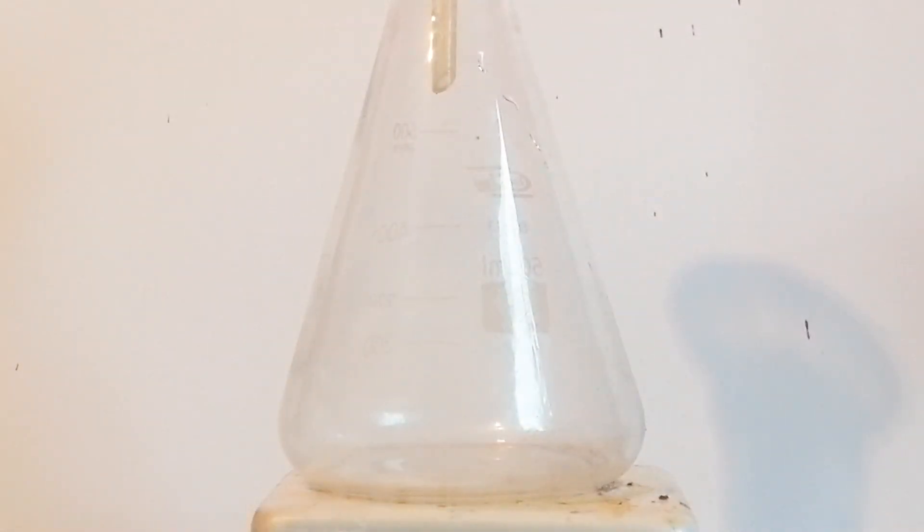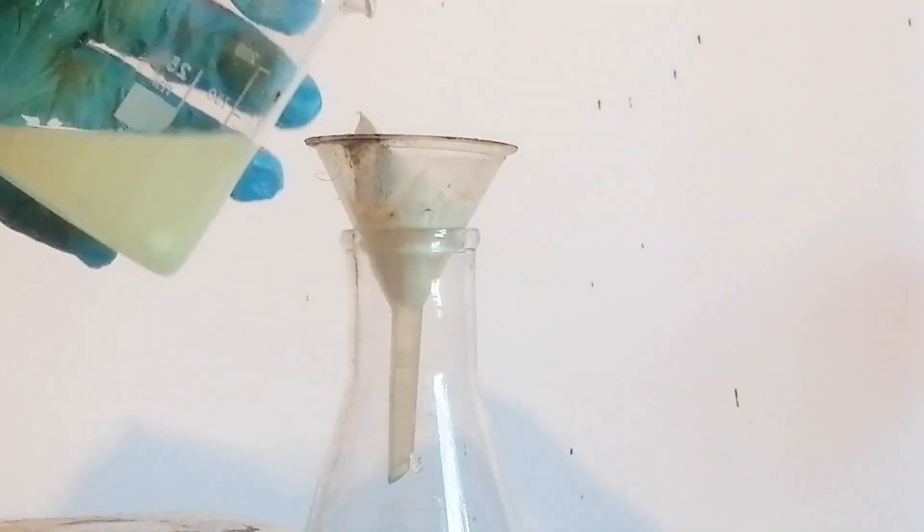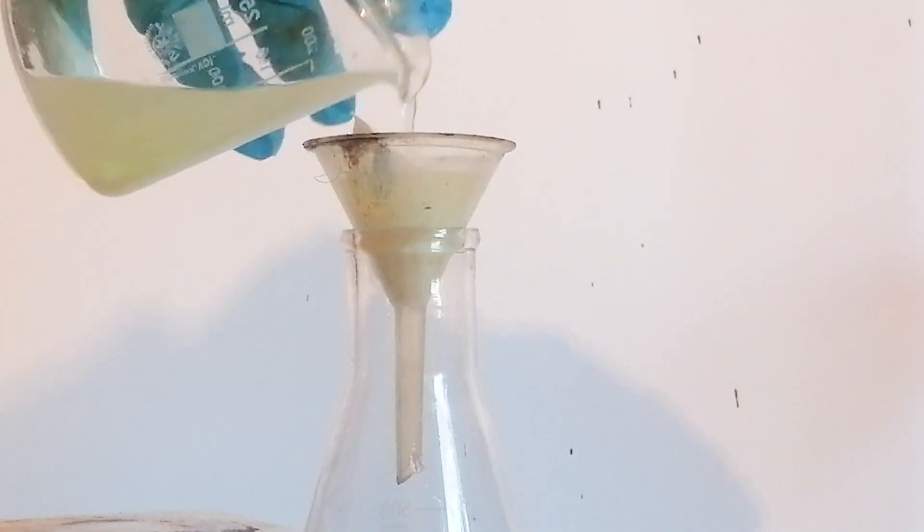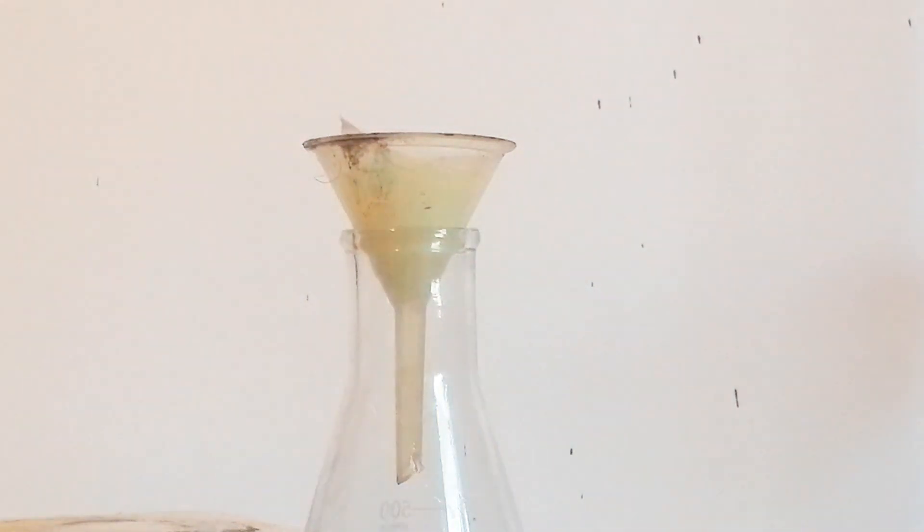So I've decided to play it safe and I've prepared a gravity filtration. I will be passing the solution through some toilet paper to separate the insoluble iodoform from the solution. I've later tested the filtrate for the presence of hypoiodite in it by adding some acetone, but barely anything came over. So here's my iodoform on the toilet paper. It's really not that much, so I'll have to make another batch of it to make fluoroform.